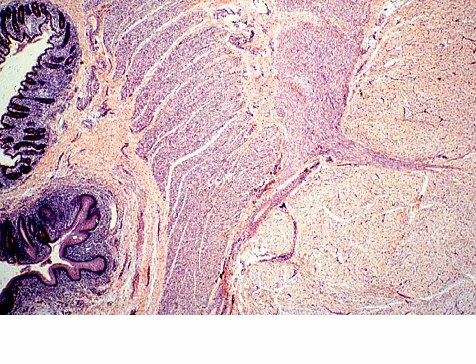Once again, as we're looking at that transition, this is a little bit on its side. Here we have anal crypts of Lieberkühn. Here we have our stratified squamous epithelium. This is going to be our internal sphincter of smooth muscle, and then we'll have our skeletal muscle, external sphincter coming in this direction.